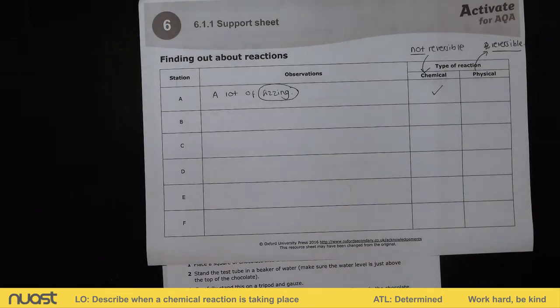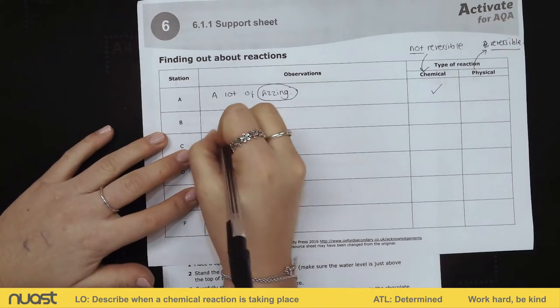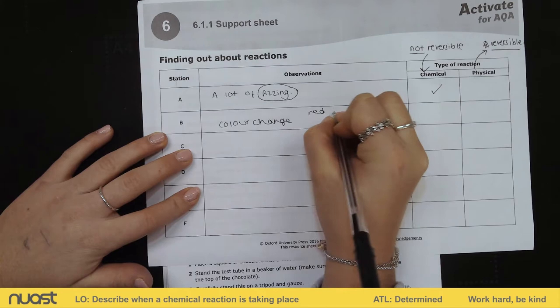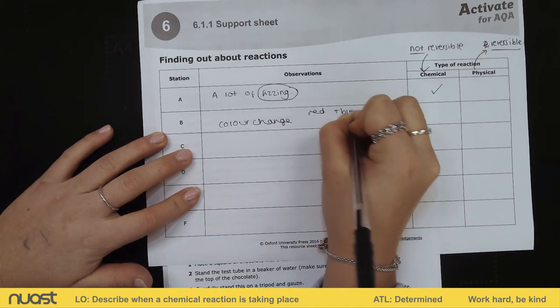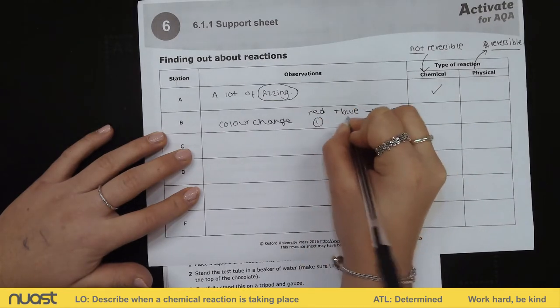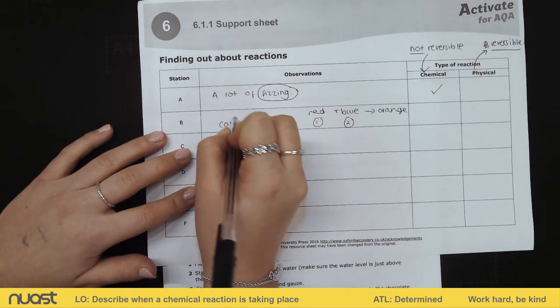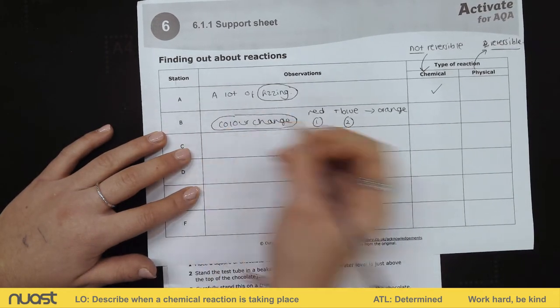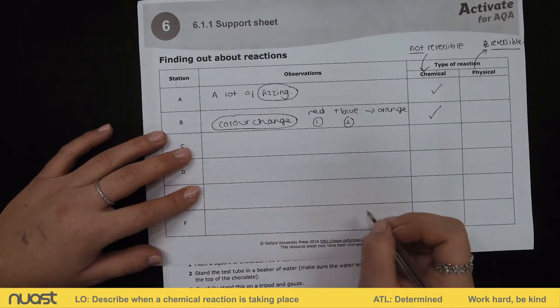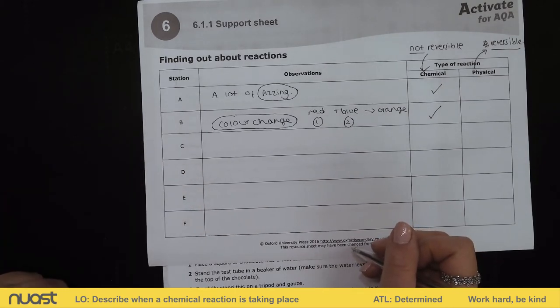Coming back to our table, for station B our observation was a colour change. When we added red to blue, it went orange. Solution A was red, solution B was blue, and we ended up with our product being orange. A colour change is a sign of a chemical reaction — it's a non-reversible reaction.